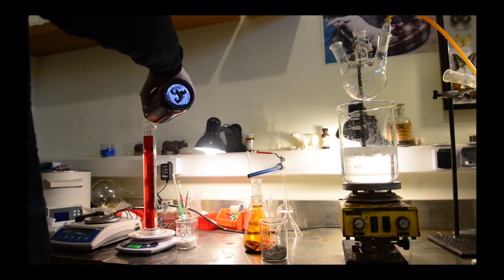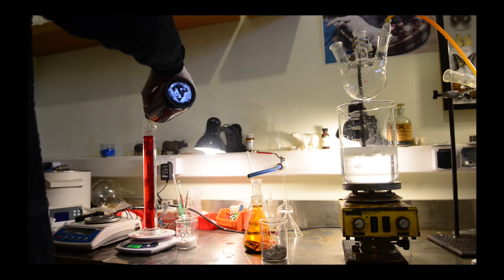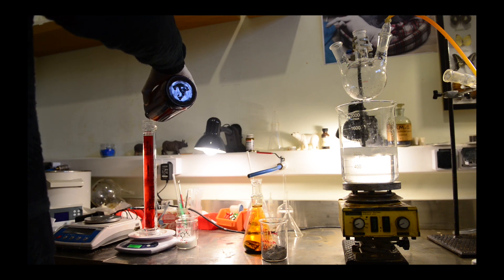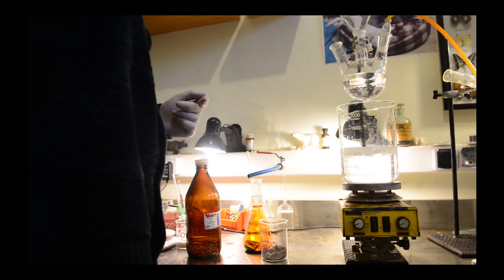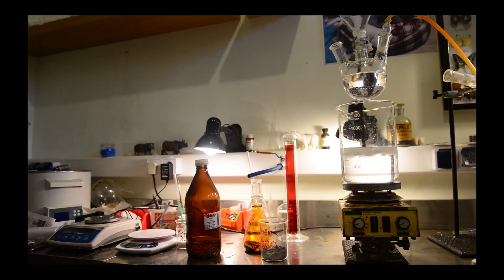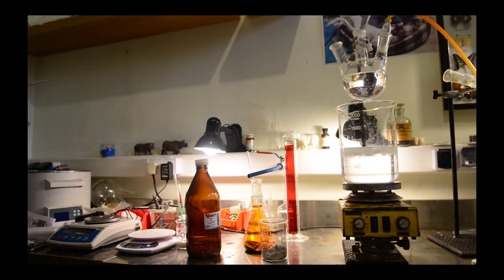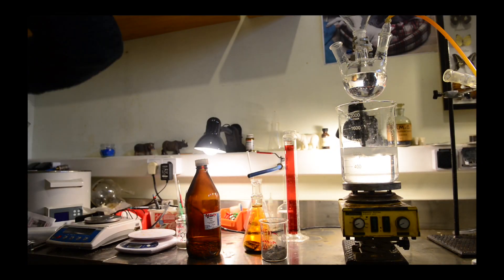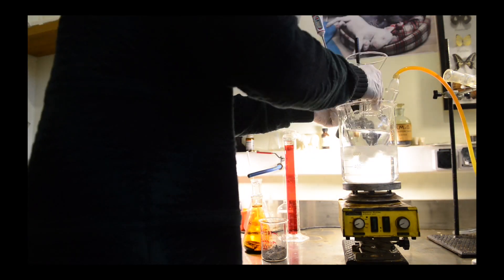At first I'm suspending aluminum powder in 250 milliliters of benzene and start bromine addition. The reaction is quite exothermic. I must maintain the temperature scope from 0 to 20 degrees Celsius because below 0 degrees the complex solidifies and reaction stops. The temperature above 20 degrees will cause the complex decomposition followed by hydrogen bromide evolution.